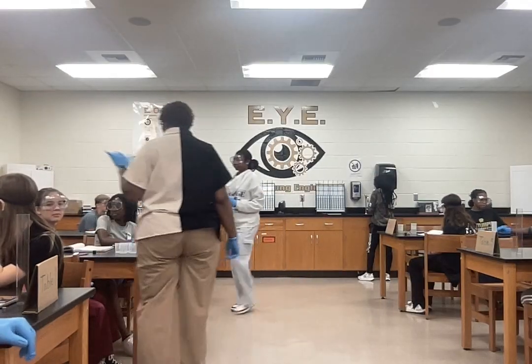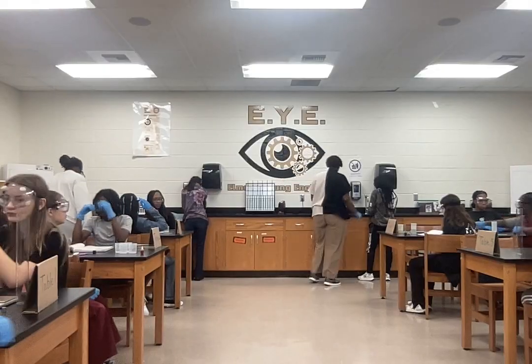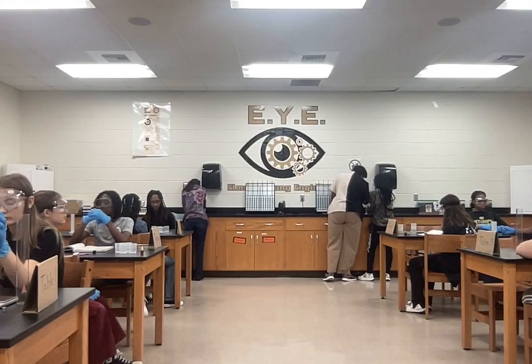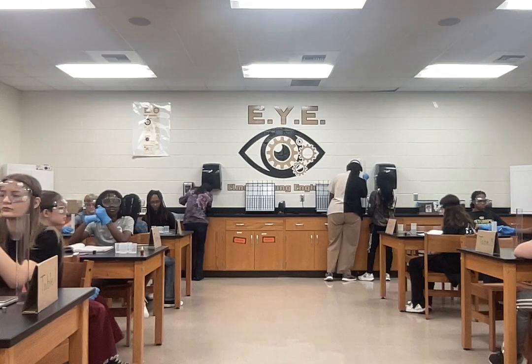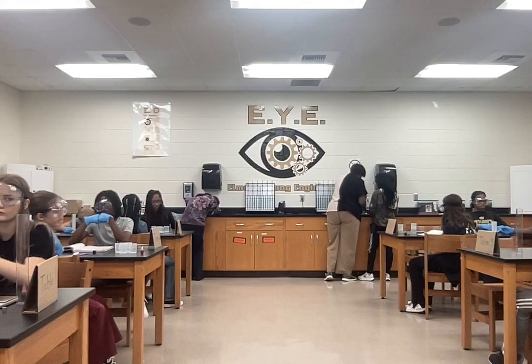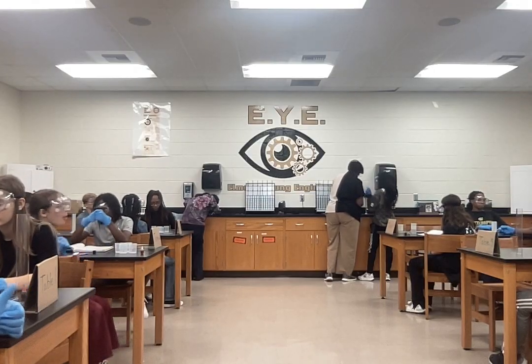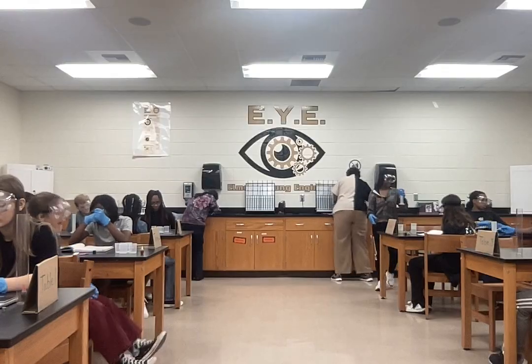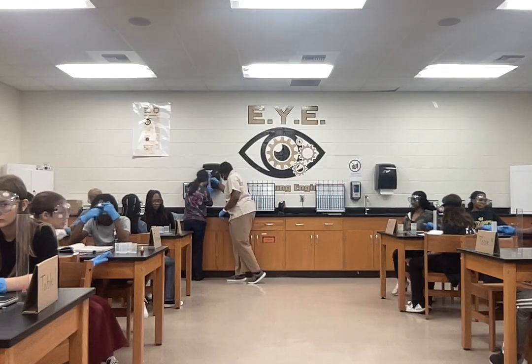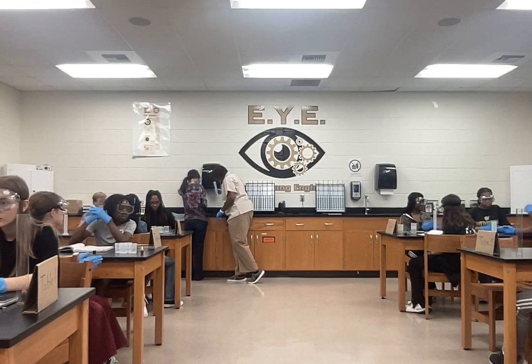That'll be okay. As close to 25 as possible, guys. If you're at 26, we'll work with that. If you're at 24, we will work with that as well. Remember to read the meniscus, so you're right at 25, so let's go over and pour that out. And it doesn't have to be exact. You got it? All right. Let's look at it.